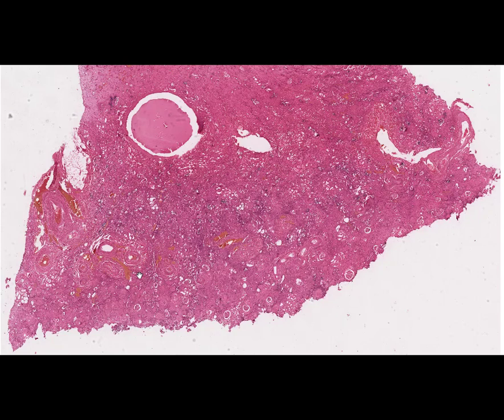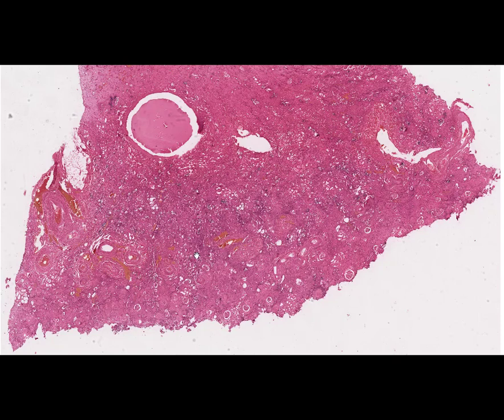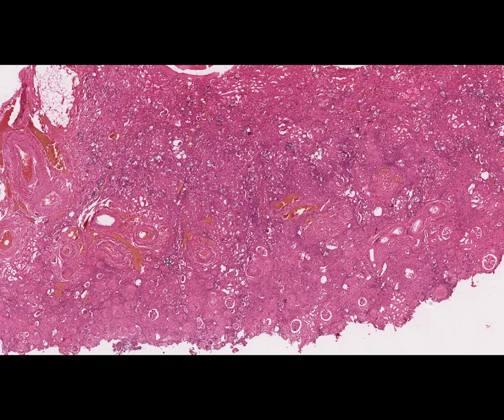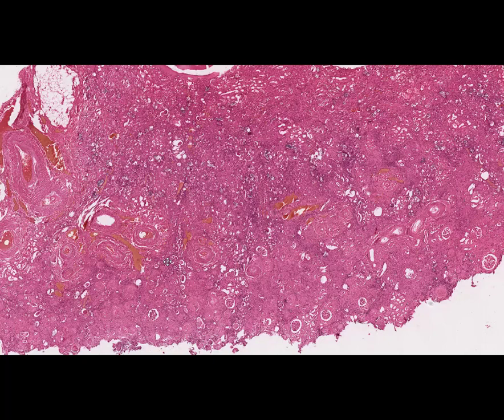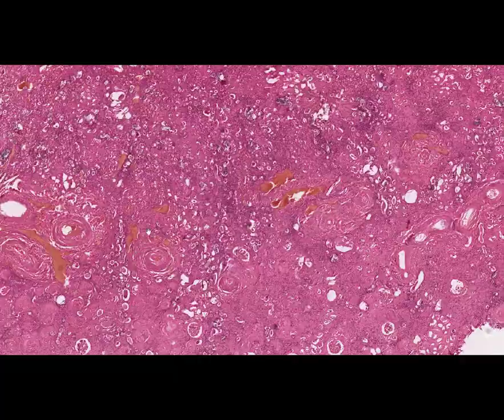It can be acute or chronic, manifested as one of the types of exudative inflammation, mainly serous or purulent. At low magnification we can observe major changes in the microscopy of renal parenchyma. The morphological changes found in the kidney are as deep and severe as the course of chronic pyelonephritis is longer.